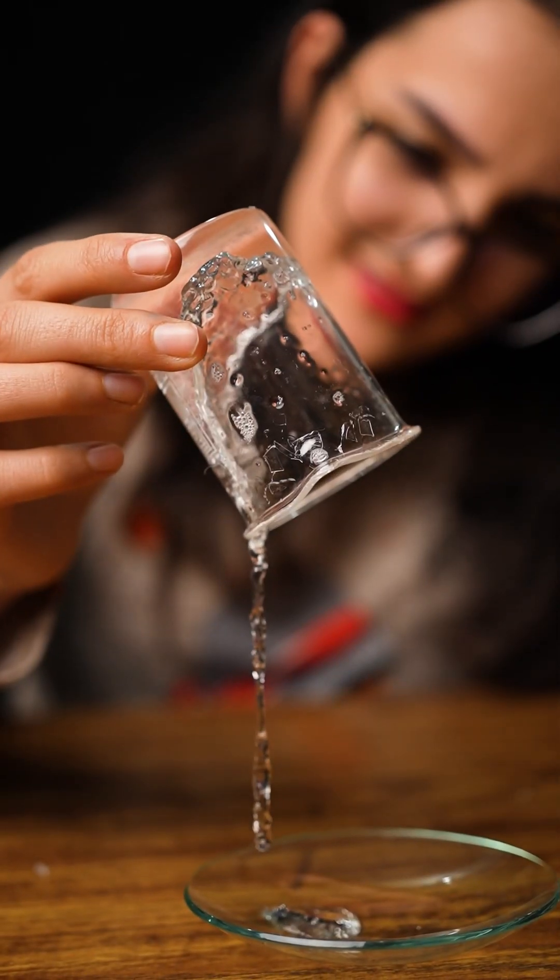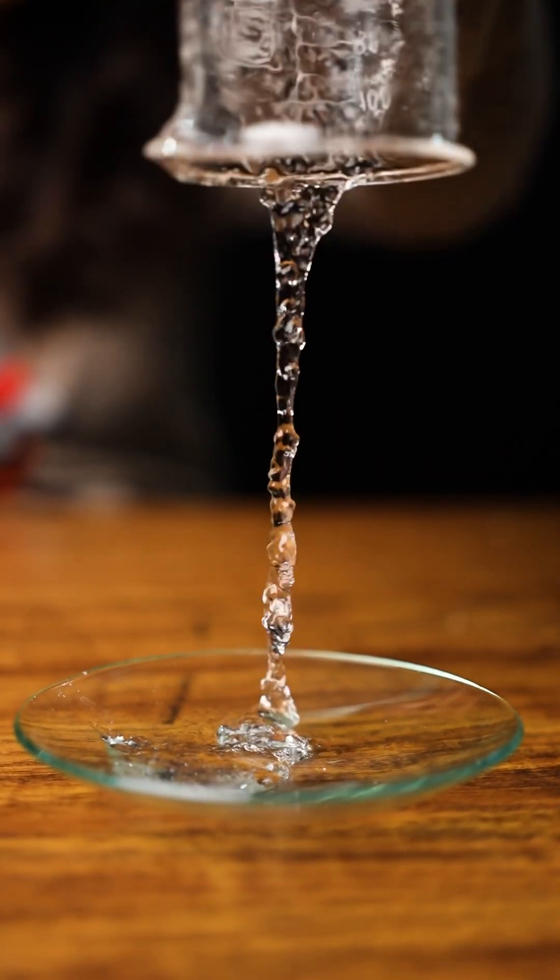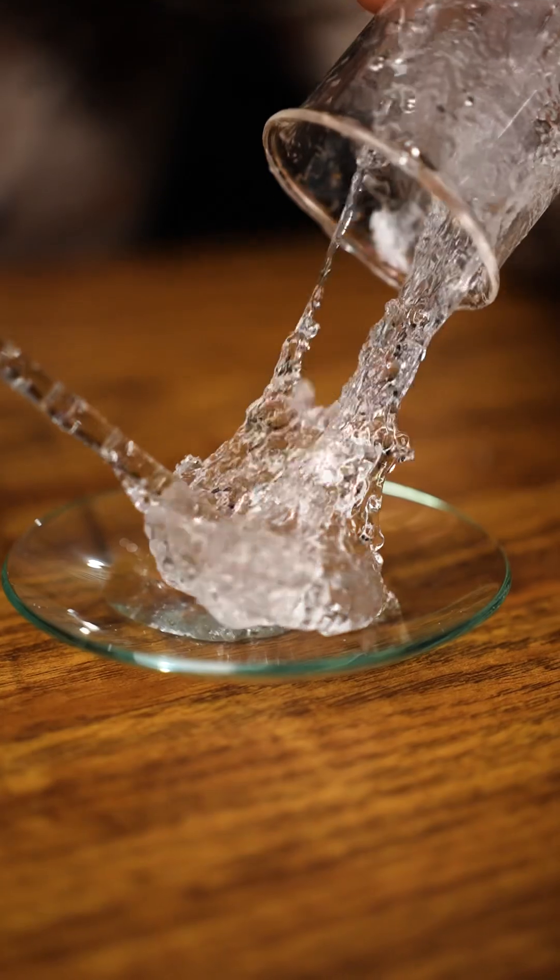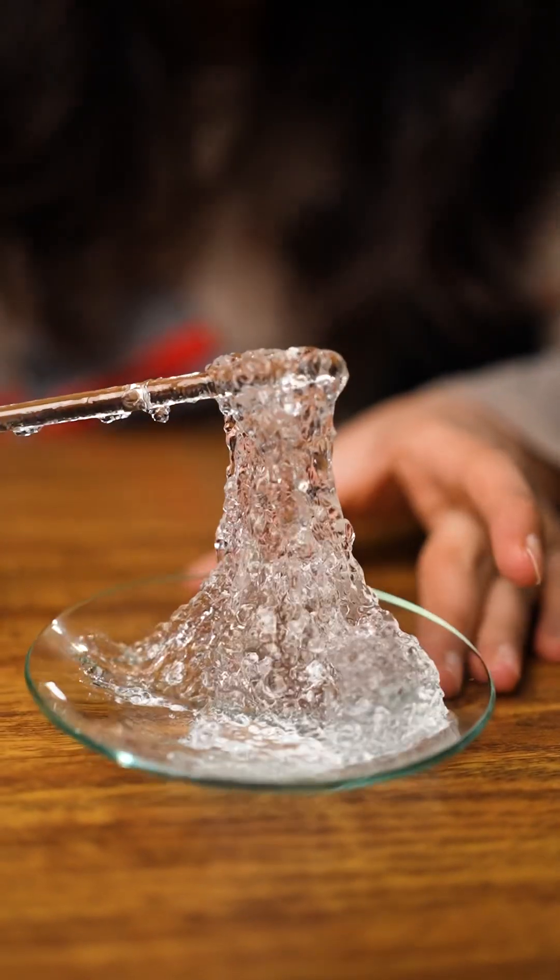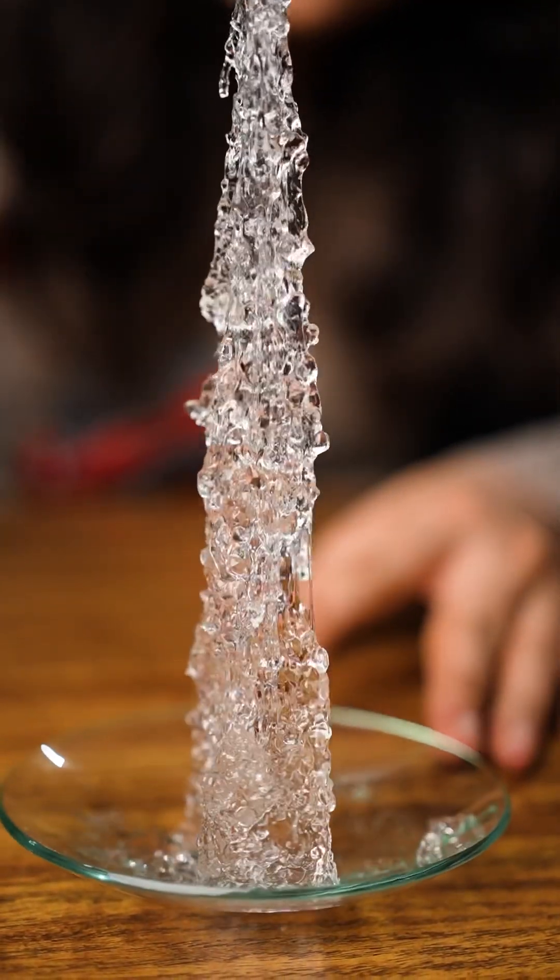Completely mixing the entire solution needs a much stronger mixer, which I don't have currently, so I'm going to be having fun with what I already have.